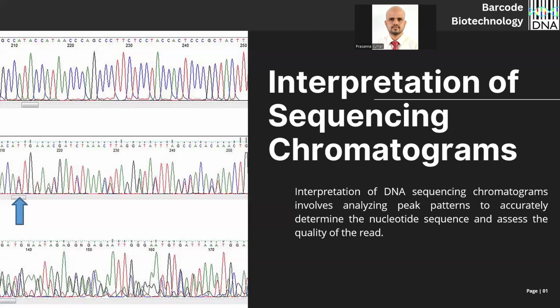So what is this interpretation? The interpretation means nothing but analyzing the peak pattern. Every nucleotide has four colors for four different nucleotides. These peaks are nothing but the dye fluorochrome molecules detected by the laser sensor of the DNA sequencer. So you have to analyze the peak patterns to determine the nucleotide sequence and assess the quality of the read. Just by seeing, I would say this read is fine, and here we may have to be more careful. I will tell you step by step.